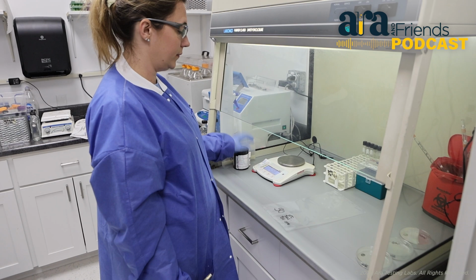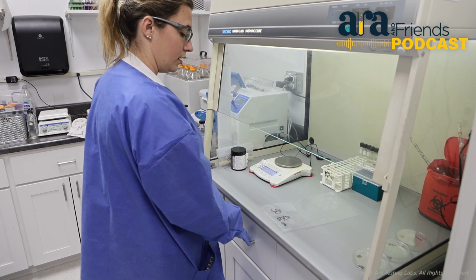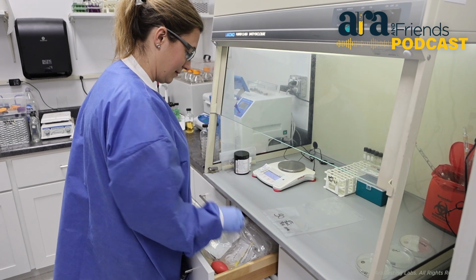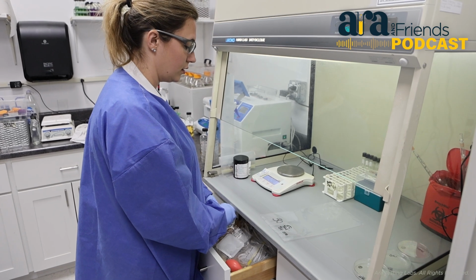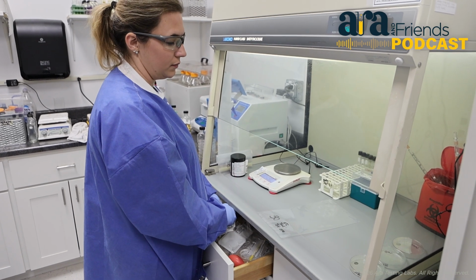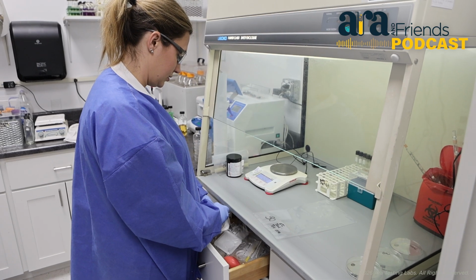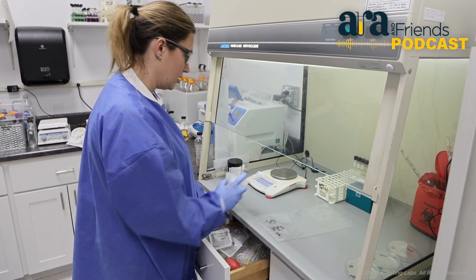I'm going to be weighing up a sample that needs full USP methods and micro. That's got all of them. Okay. So you're going to weigh it once and try and pull for APC, yeast and mold, coliforms, E. coli, salmonella, and BTG, yes. And Entero. Okay. So these are little sterile weigh boats.